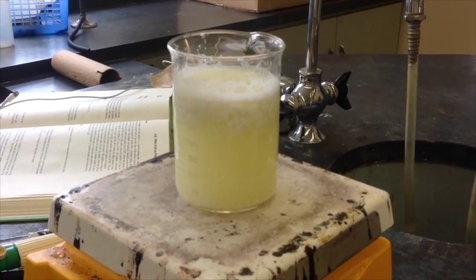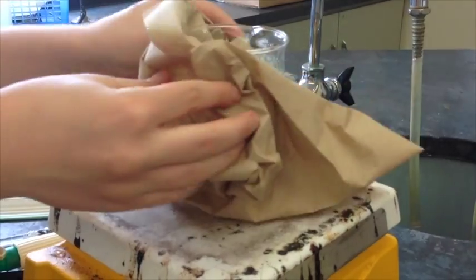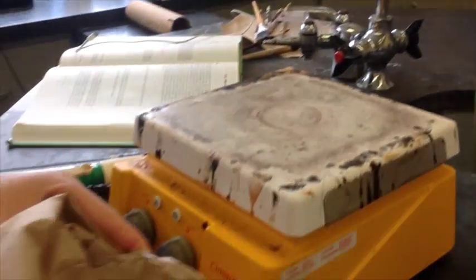Once there looks like there is a clear separation from the solid and the liquid, remove and get ready for the next step.